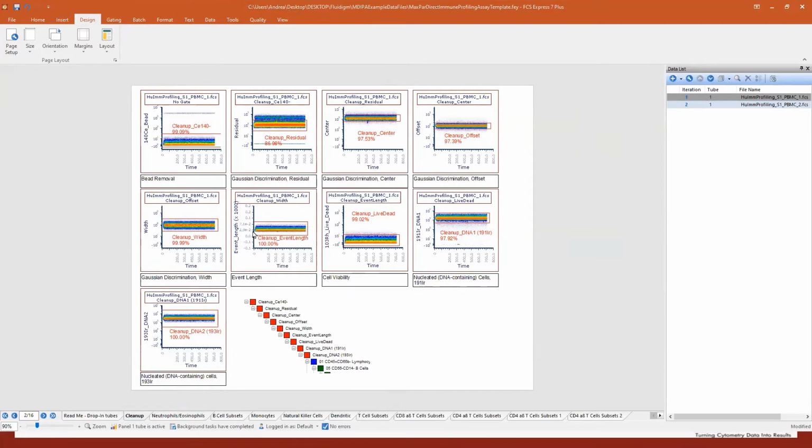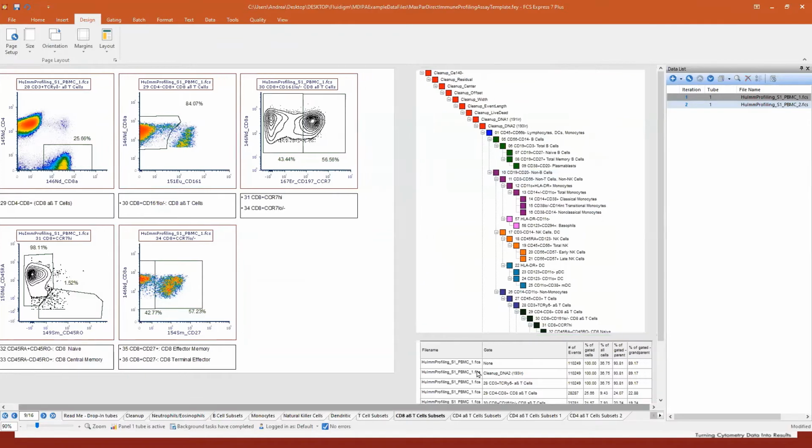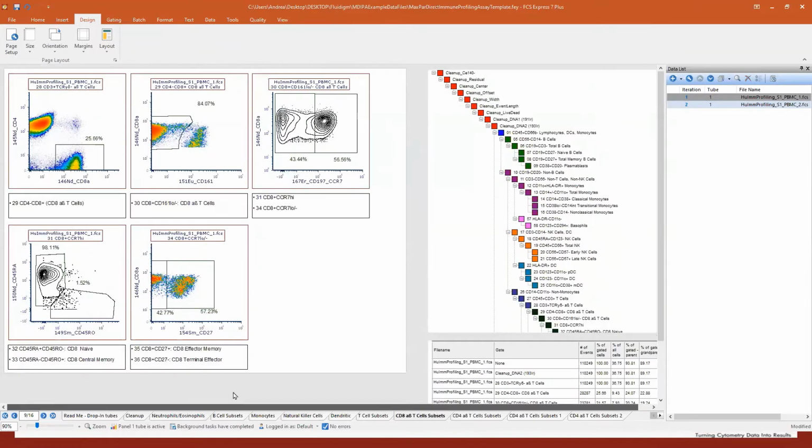We will see how to create this. I'm just showing you that you can combine plots in a page, as you can see here. You can combine text boxes, you can bind the hierarchy, and then you can move on. For example, let me open the CD8 page. Here I have a CD8 page. I have my gate hierarchy here. I have some statistics here. You see some tables, and I have some plots, well organized as I want.